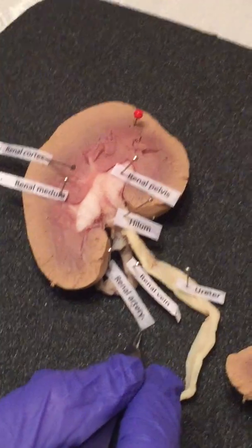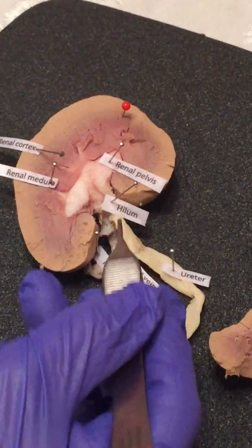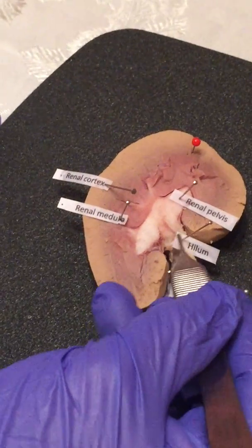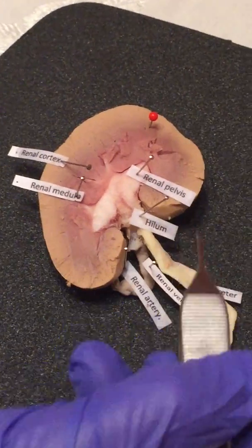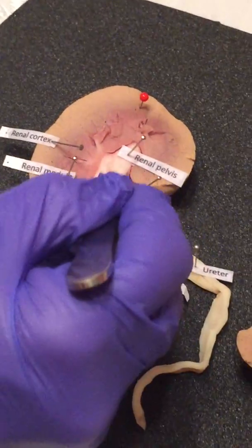And then we have the artery, which supplies oxygenated blood to the interior part of the kidney here. And then we have the hilum, which is in this small concave portion here, and this allows the nerves, the veins, artery, and the ureter to connect to the kidney itself.